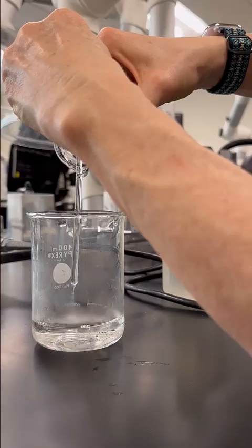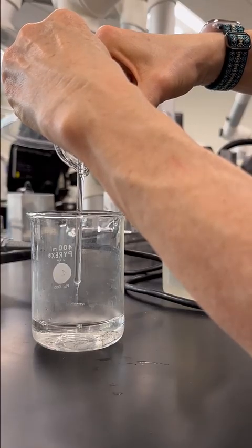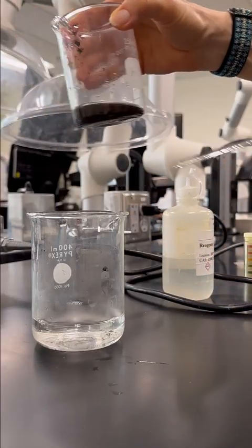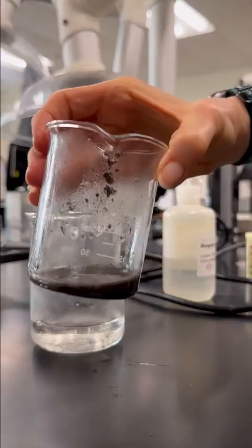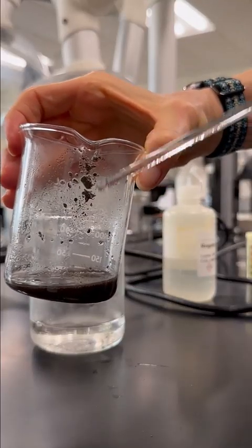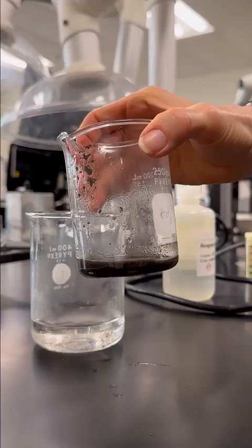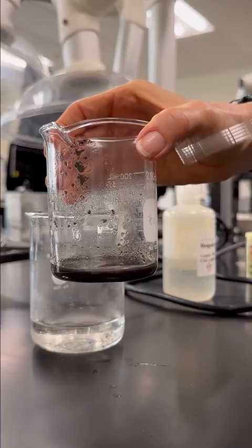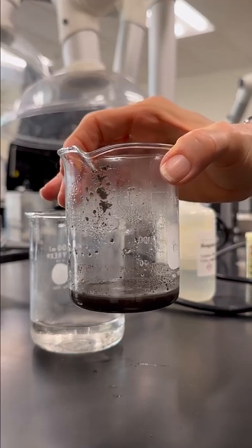All right. So I won't be able to get off all the liquid at this step, but I'm going to try to get most of it off of there. All right, so my final solution looks like this. You can see I do still have some black up at the top here. We'll wash that down in the next couple of steps and make sure that we recover that copper. We need to get that back.